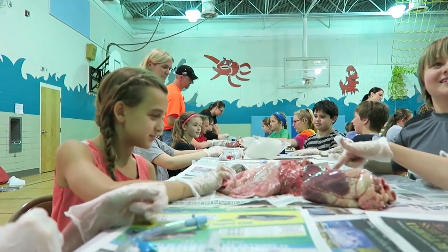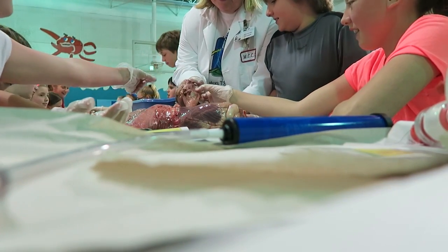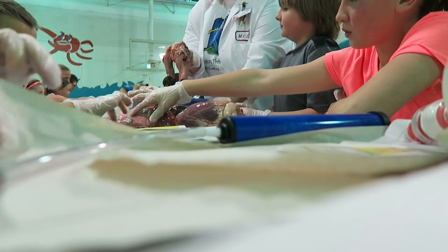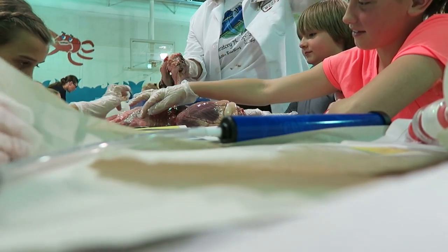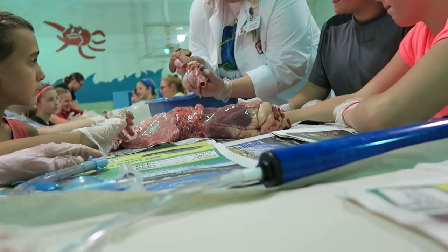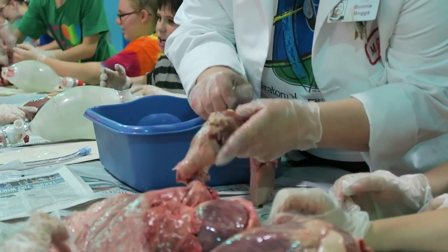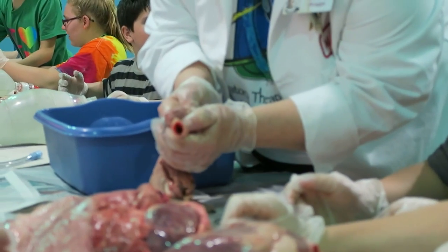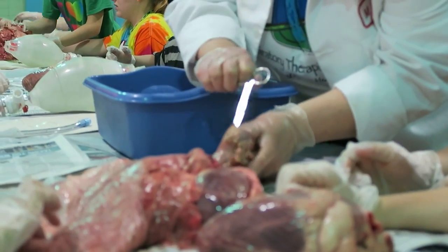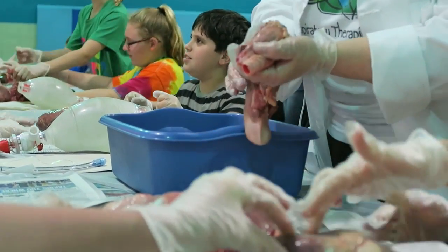I was so nervous about this one. It has a bunch of little small things inside — it feels like bone. It's got a texture. This is the breathing one — it goes down the breathing tube right there. And if you go through the back of that, it goes out the food tube. That's why sometimes you swallow and cough, because it went down the wrong tube.